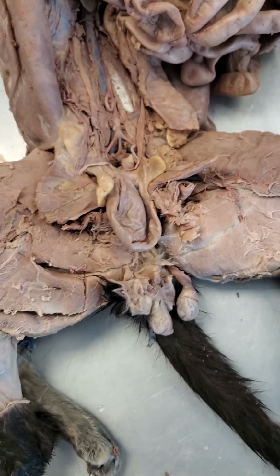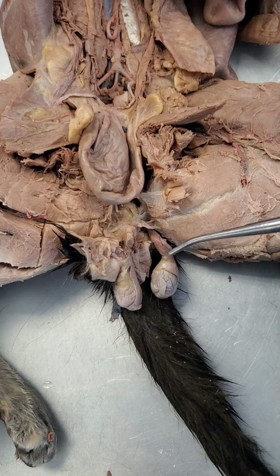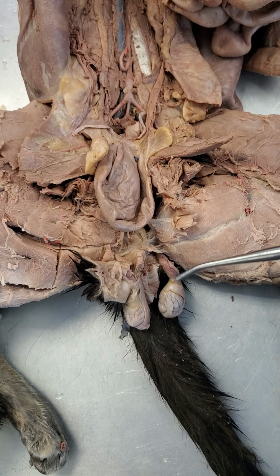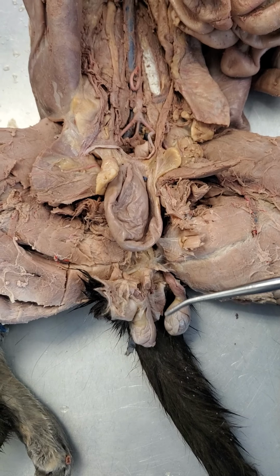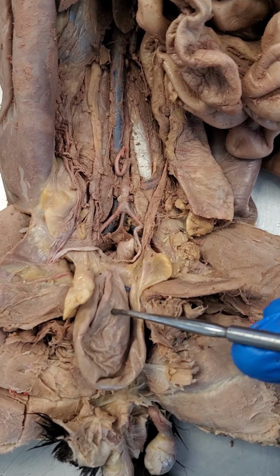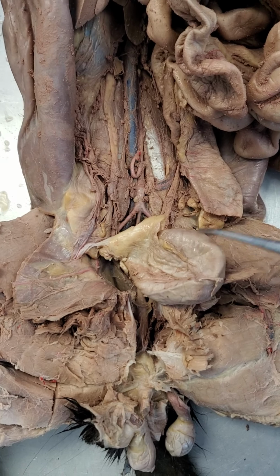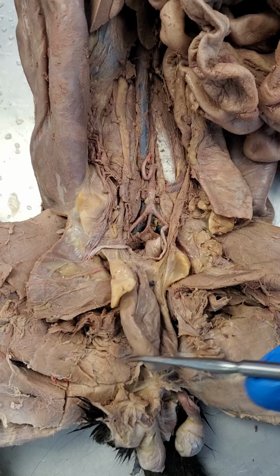Now, of course, if we look at the males, there are a couple obvious external structures. You can see the testes down here, which we've dissected. But for some reason, if you did not have those in sight of either the image or video that you might be looking at, one thing to do if you can see the inside of the abdomen of the cat is to fold the bladder down this way.